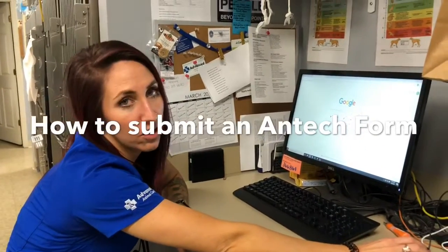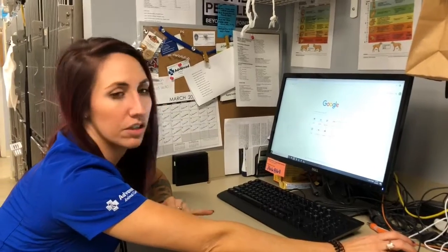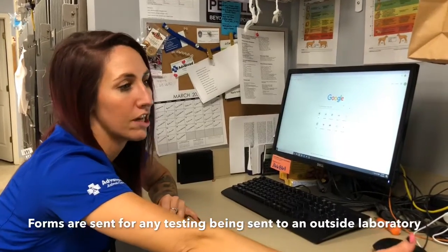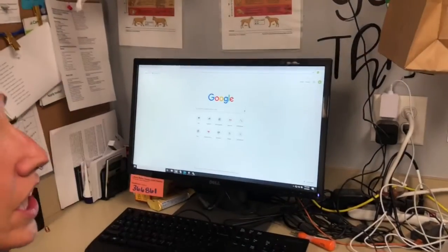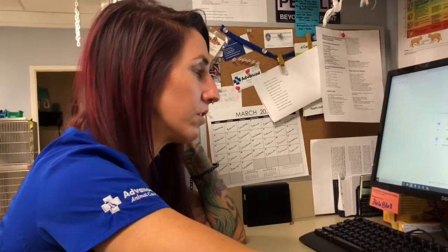So in this video, I'm going to show you how to submit an Antech form, which is a form that gets printed out for any blood work, urinalysis, anything going out to our outside laboratory, which is especially important for things like canine and feline annual wellness. That's included in our package. So it is something that gets done often.